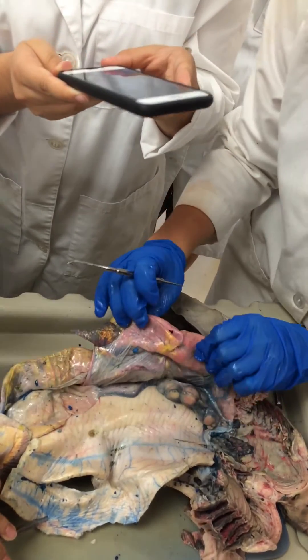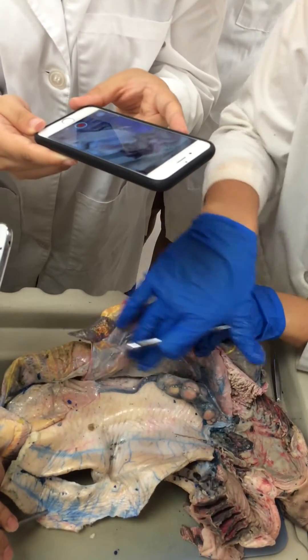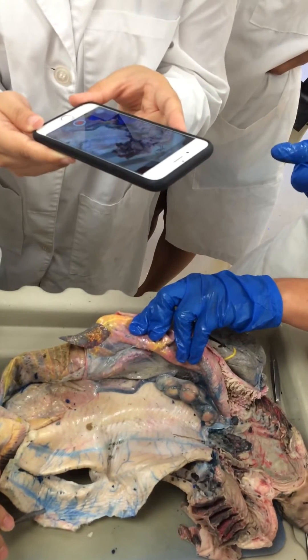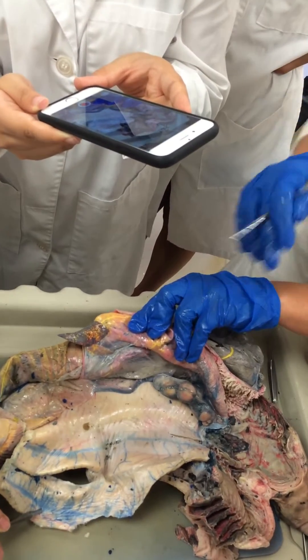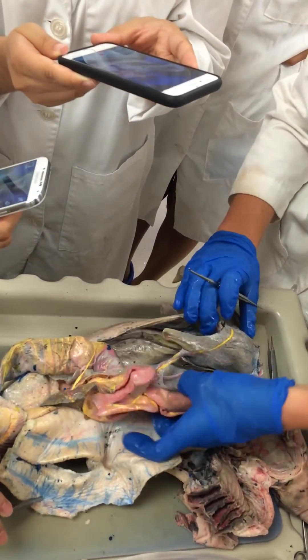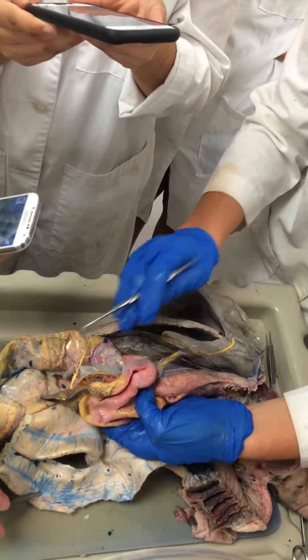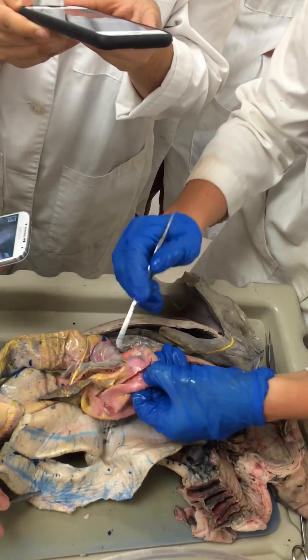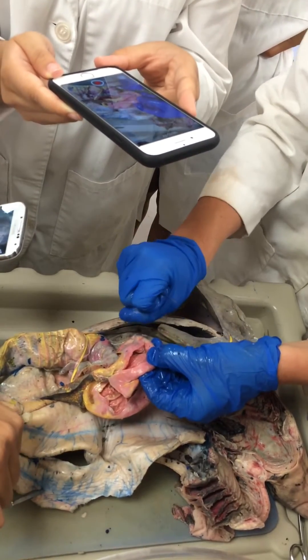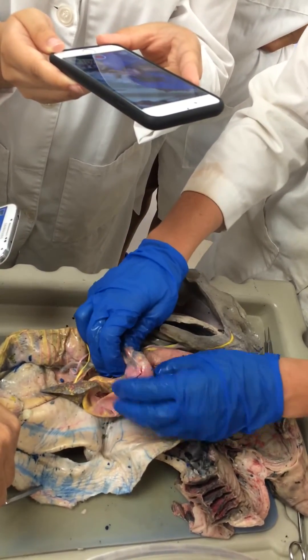If we pick up the stomach, you can see there's a mesentery here that can be called either the greater omentum or the mesogaster. 'Meso' referring to mesentery and 'gastro' for the stomach. So this is either the mesogaster or the greater omentum. The pyloric region of the stomach terminates at the pyloric sphincter right here. The pyloric sphincter can either open or close to keep food from going into the intestines too early, or open up if it needs to pass to the small intestines.